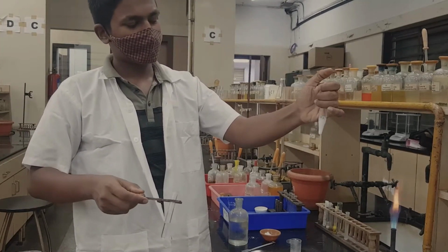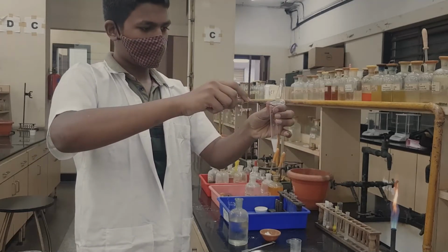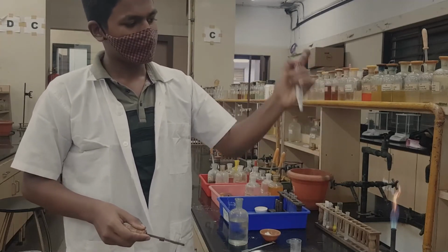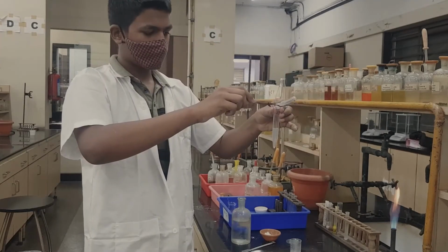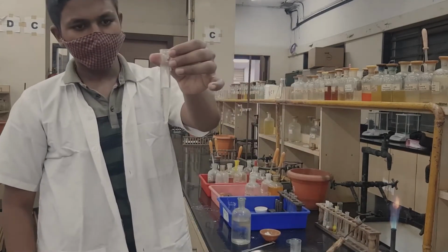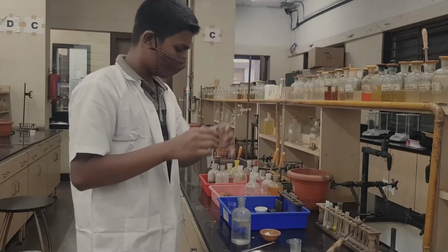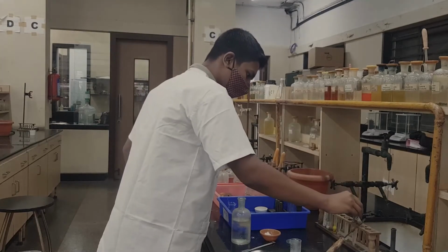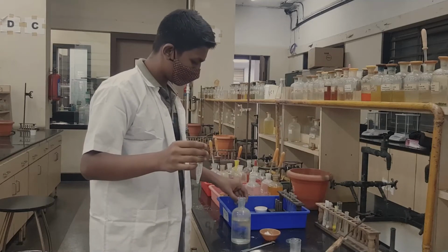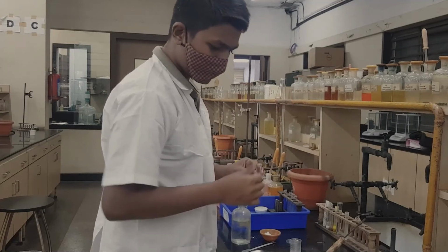Just jerk it and you will see the carbonate, because I told you it is the carbonate of group 5. So you will be able to see the effervescence being released. Once it becomes transparent, you are ready to do the analysis of that particular group. In this case, we are going to do the analysis of group 5. We have a transparent TS. As you can see, it was a white PPT earlier. Now we have a clear transparent solution, just similar to your OS.